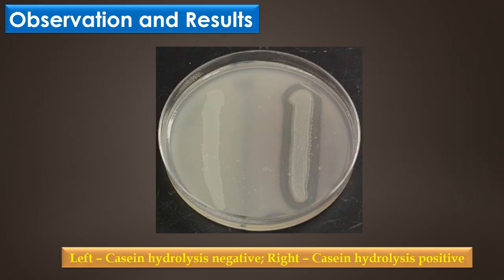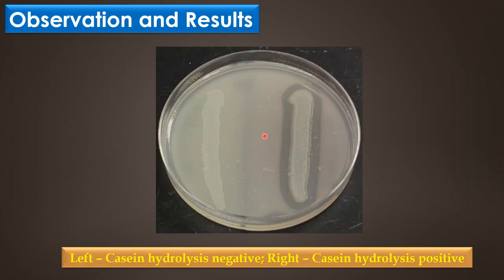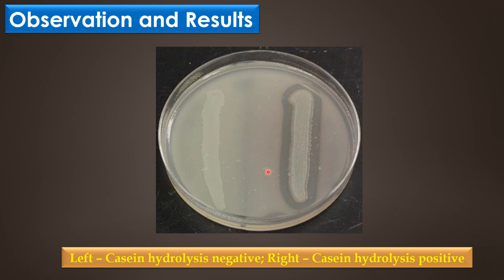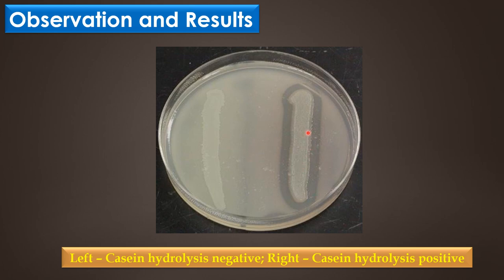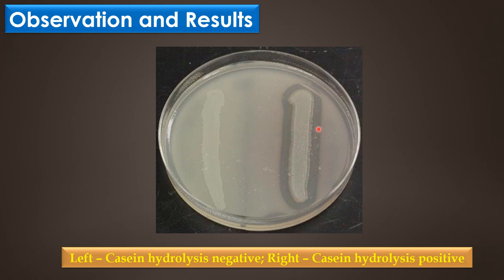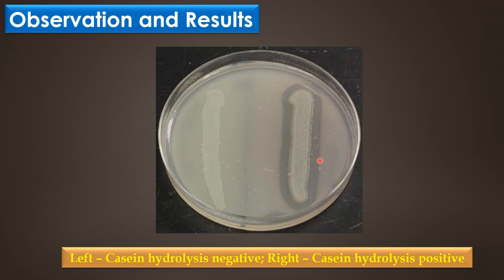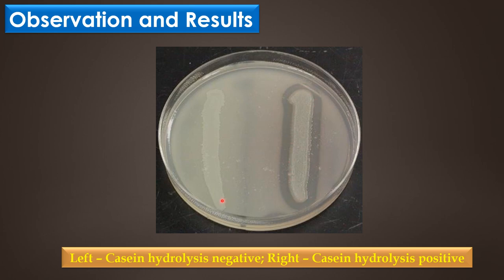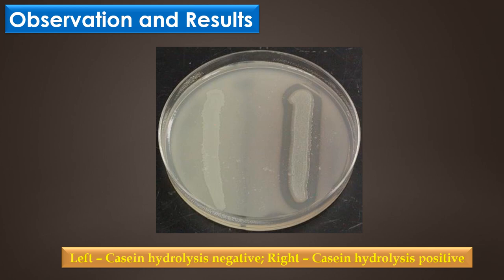This image shows the casein hydrolysis test result. Here the clear zone is observed in the casein hydrolysis positive result, and this is the casein hydrolysis negative result with no clearing visible.